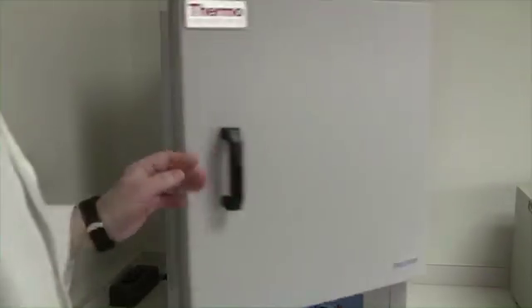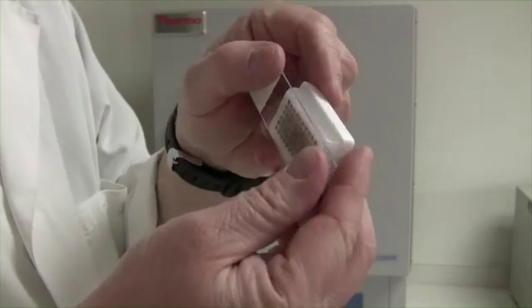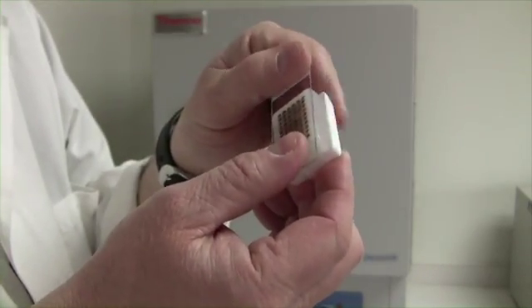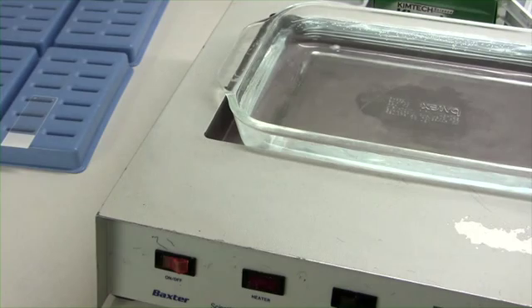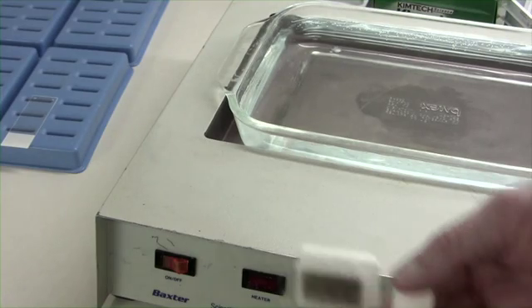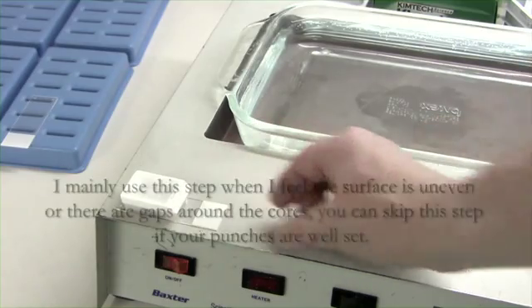Now you'll need to remove the array block and slide from the oven, but don't separate the block and slide yet. Since I only have one oven and the array block needs to stay warm and soft while the single slide is heating in the oven, I'll explain why in a moment. I'm placing the array block and slide together on the edge of my water bath. It's warm enough to keep the block soft while the single slide is heating up.